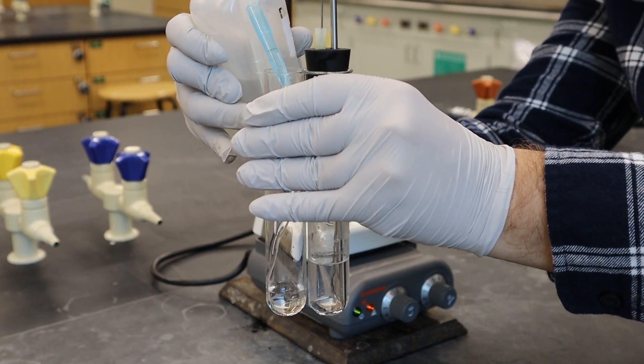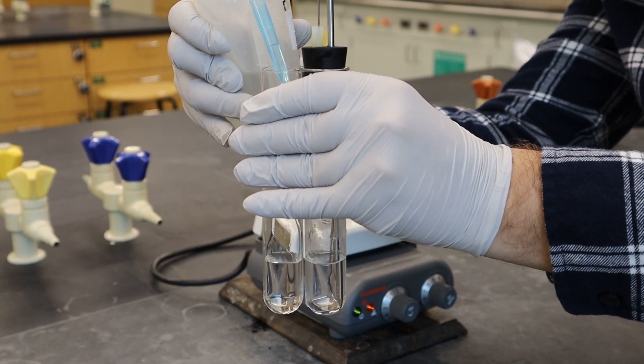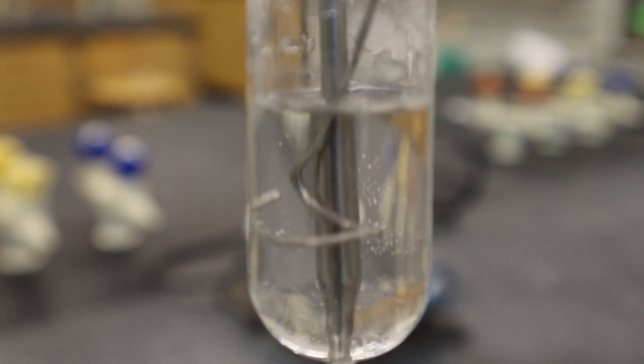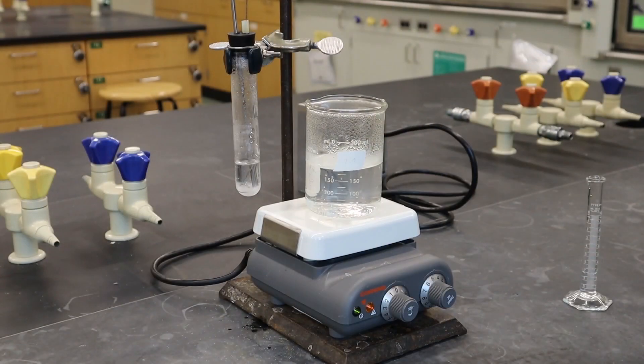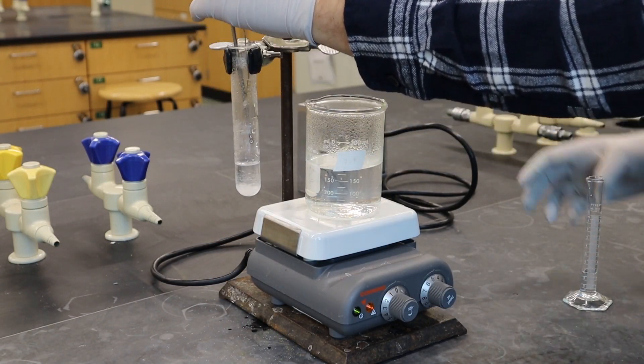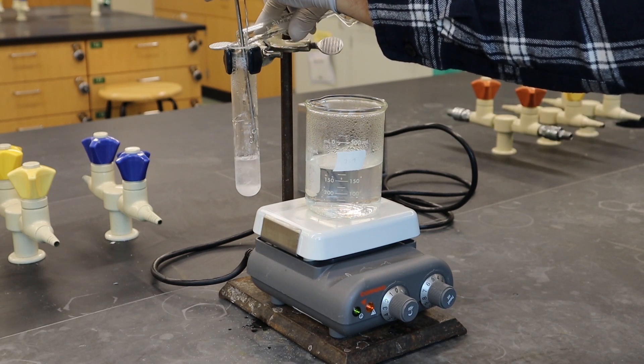So there is a volume change that's associated with dissolving this stuff and so we're gonna take a sample of clean water measured out and go from there. So then as we let it cool down you're eventually gonna get little crystals to form in there and then you measure that temperature. And so that's gonna be the temperature at which that was soluble at that volume.